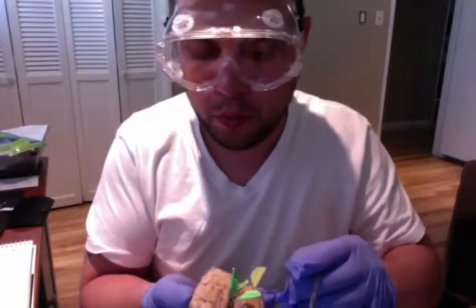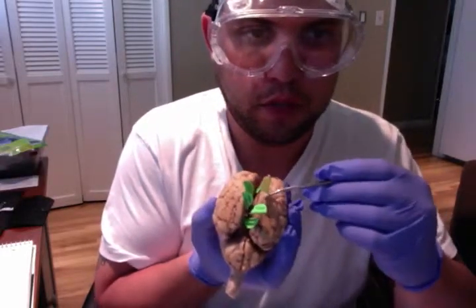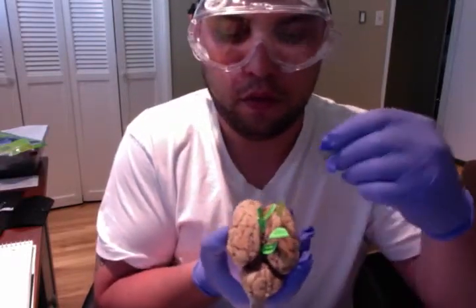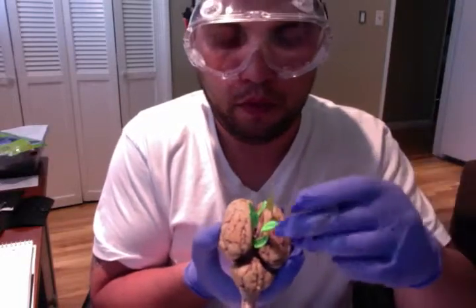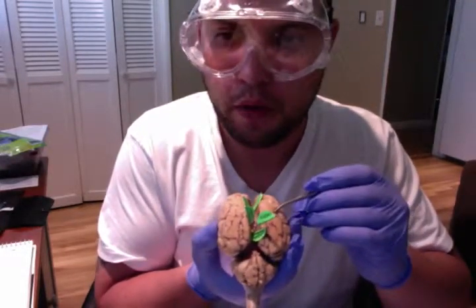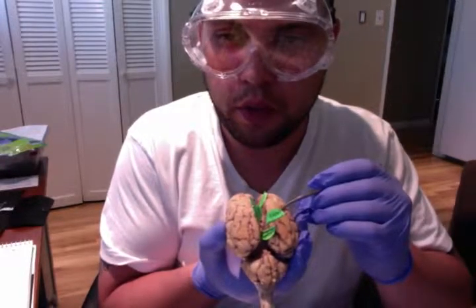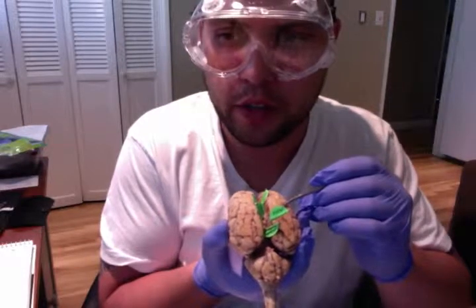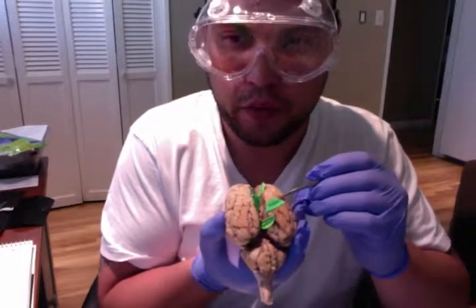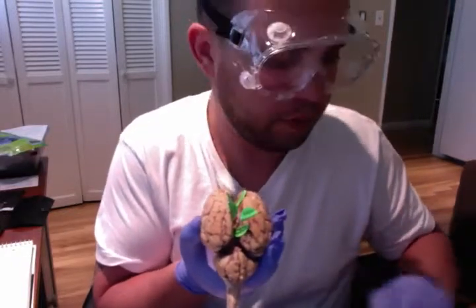Moving on to the sagittal section of the brain, we have the cerebrum. The cerebrum is this vicinity here, this whole top area is cerebrum. And the cerebrum, the top of the brain, adjacent to the longitudinal fissure of the cortex, is the largest part of the brain associated with higher brain functions such as thought and action. The cerebral cortex is divided into 4 sections called the lobes: frontal, parietal, occipital, and temporal lobes.